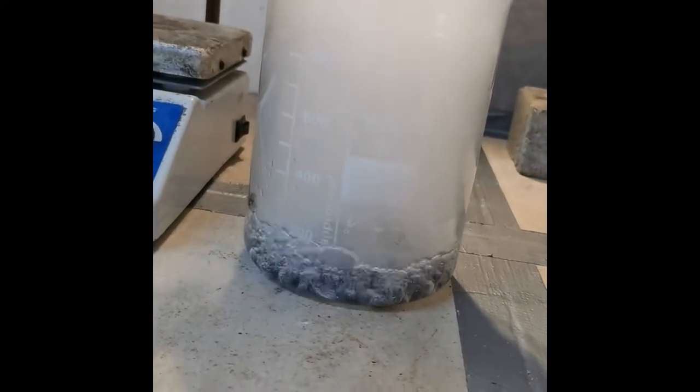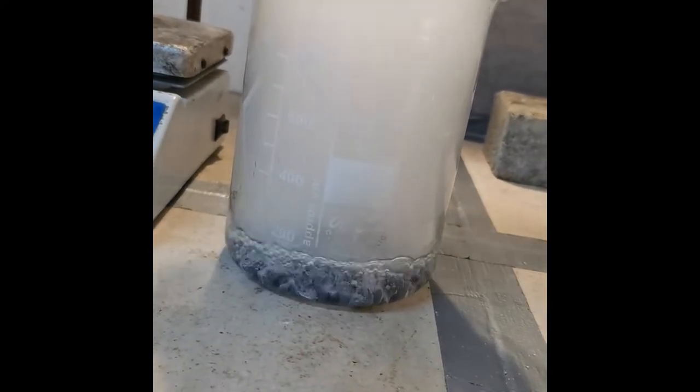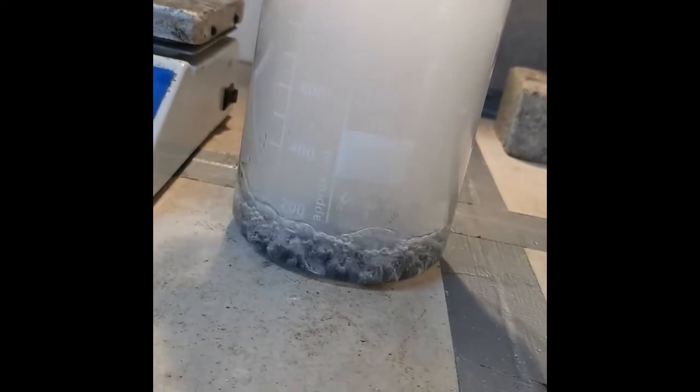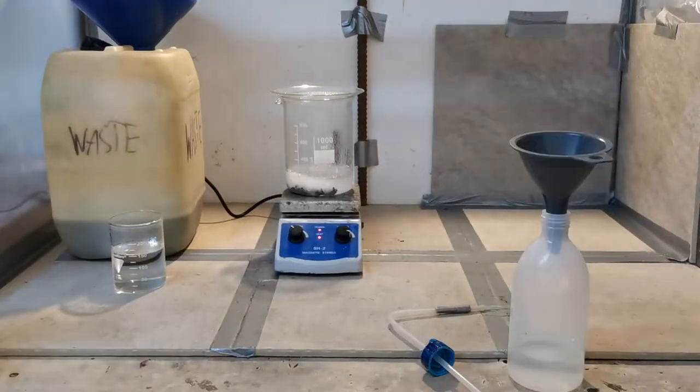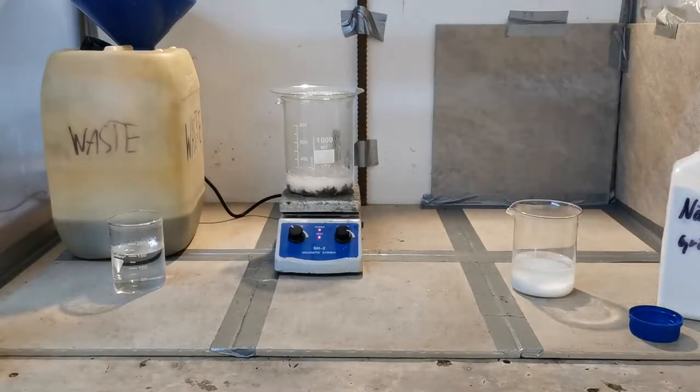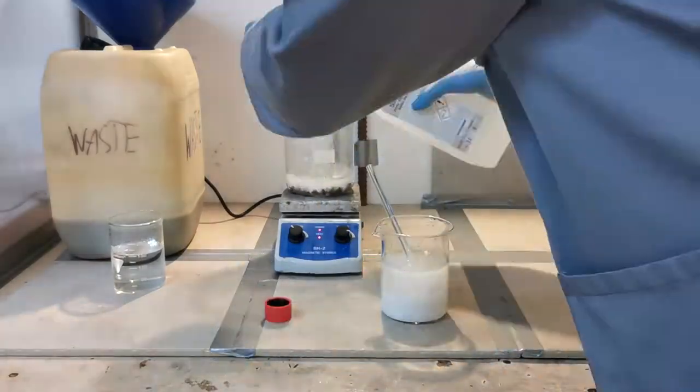So off camera, I decanted off the acetic acid and put the zinc in a larger beaker with some hydrochloric acid. The acid started to react immediately and within half an hour all of the zinc was dissolved. I was quite impatient though, so I added way too much HCl, which I will later have to neutralize.